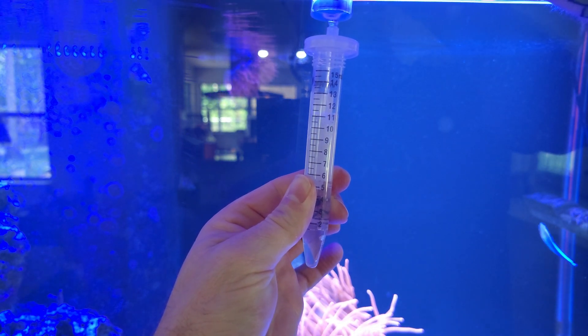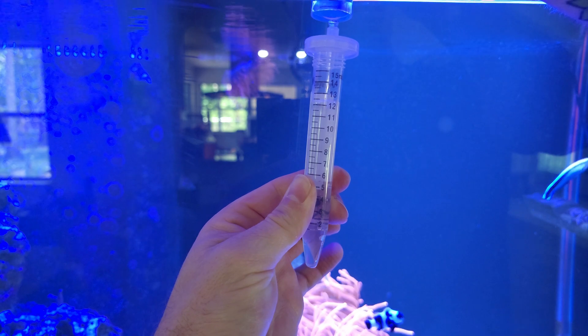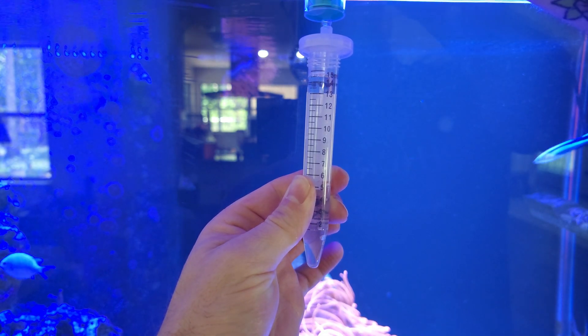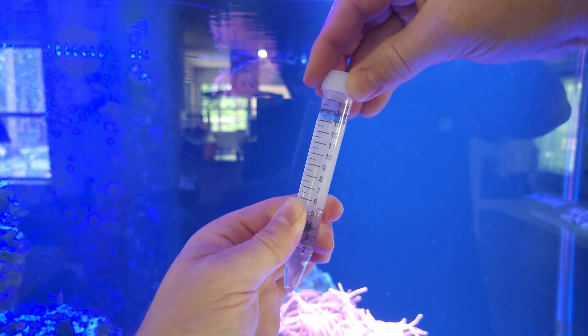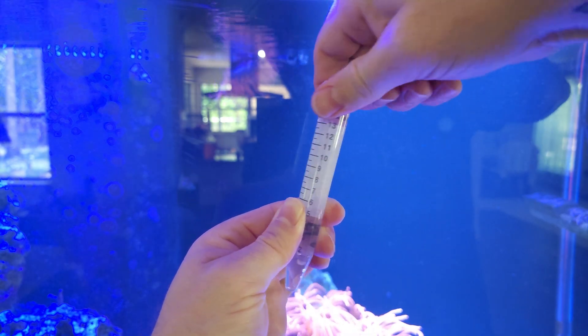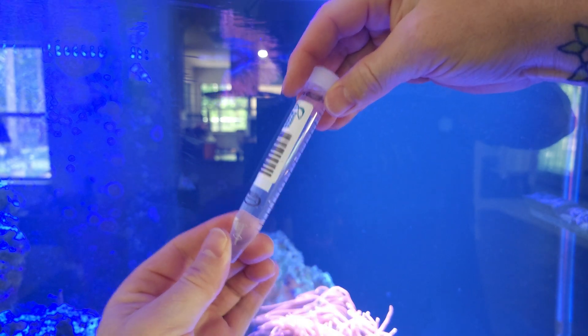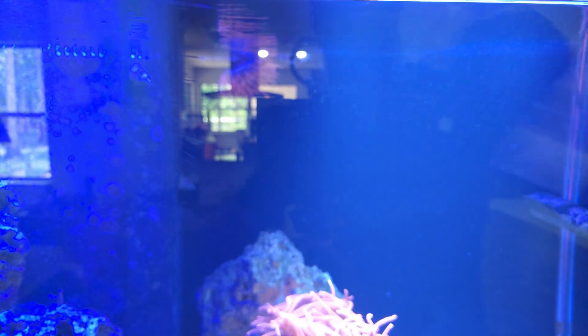Then we're going to take our vial and put the other 15 milliliters from the syringe into the vial. It is a little resistant when you push it but it will go in there all the way to the top. Toss the cap on here, do it again for the other one and you're good to go.